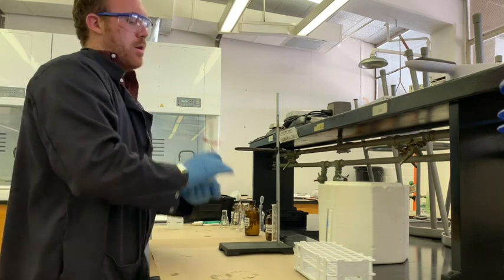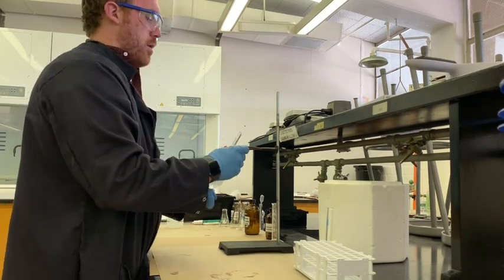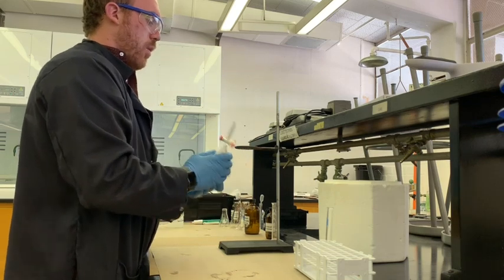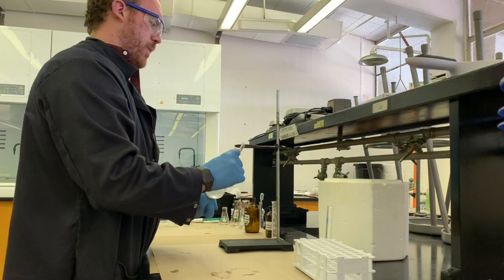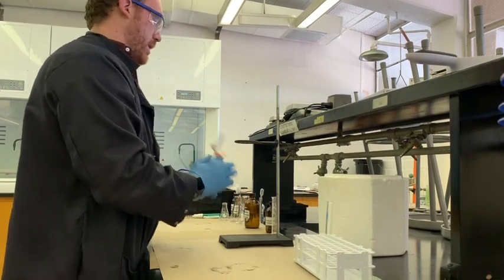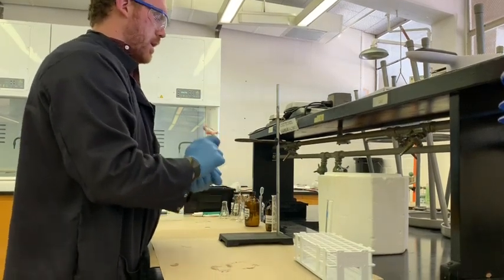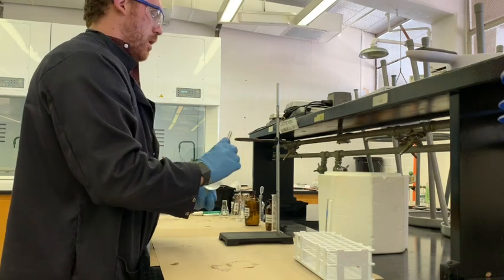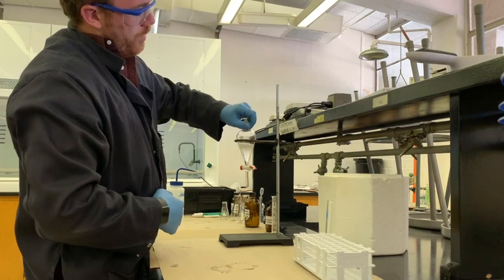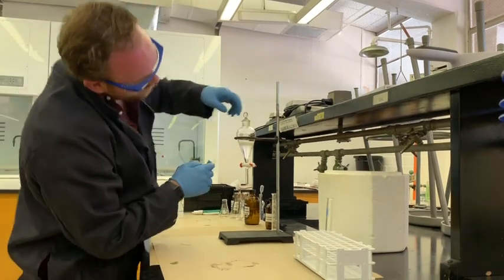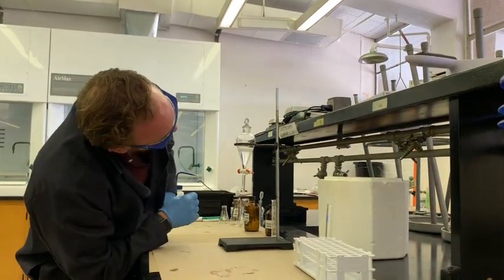Now you're mixing cold water but with strong acid. So probably there's going to be some kind of gas release. You can smell it a little bit. It's very gentle in this case. And also cold helps stifle the intensity of that reaction. So for now we'll let these layers kind of separate.